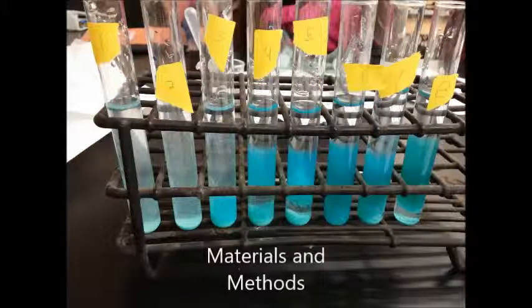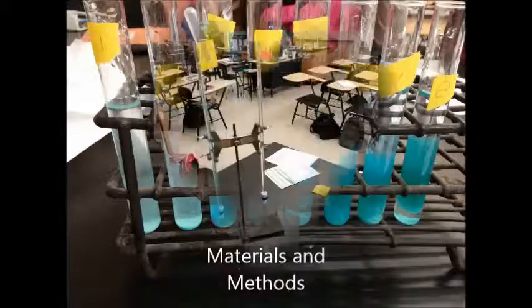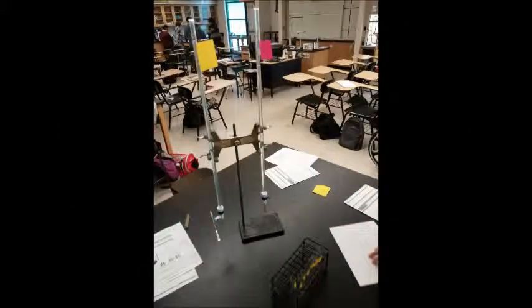We used a clamp to hold the burettes full of copper sulfate and potassium hydroxide. We then poured the amount of two solutions as instructed into each test tube. After pouring the correct amount of solution, we then stirred it and let it rest for 15 minutes.